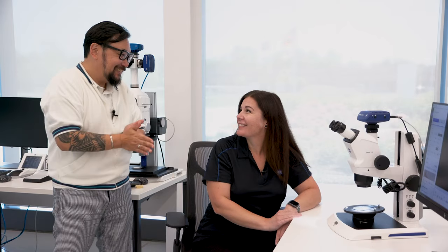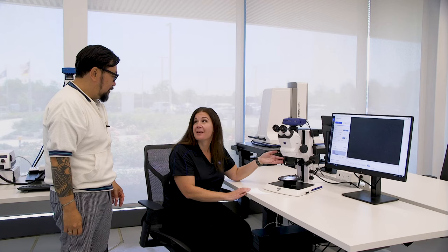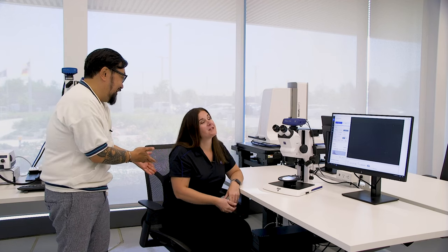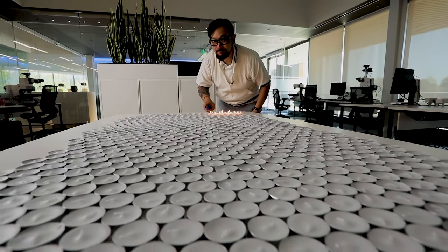So Shannon, here we are — we've come a long way. First, you can see we have LEDs to illuminate things instead of candles. This is equivalent to about 10,000 lumens, which is about 800 candles. More light means better contrast, better images — we can see more even with the same lens. It's safer too — 800 candles is a lot of candles.